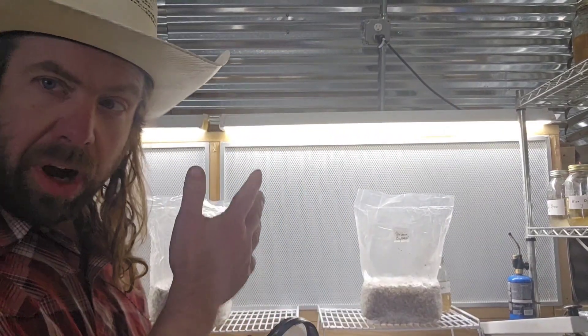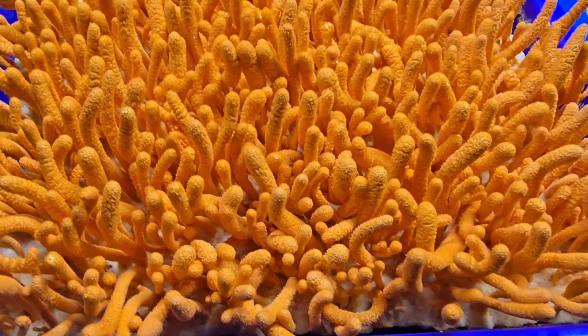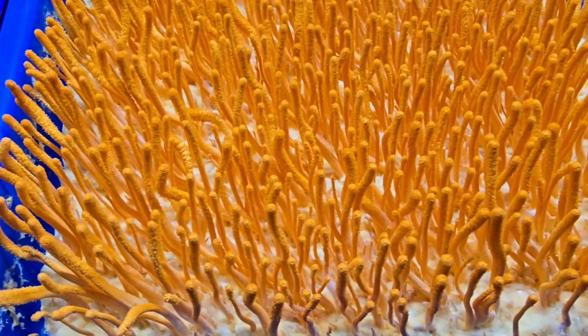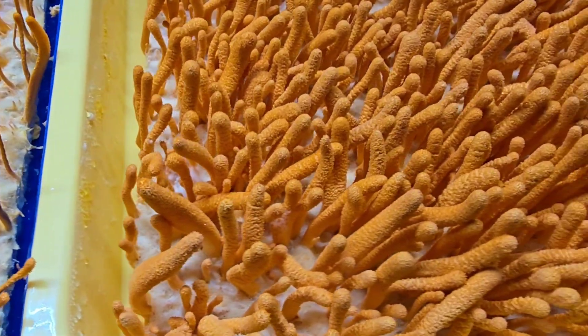Let's get into this video about the Cordyceps asco spores. I've got a few different plates here to show you. I'm also going to cover some inoculated oyster mushroom grains and do a short Q&A at the end. On the Cordyceps multi asco spore plates — in my video about cultivating Cordyceps militaris I did my first big tray grow here on the farm. I've done small jar grows before, but this is my first attempt at actually breeding Cordyceps.